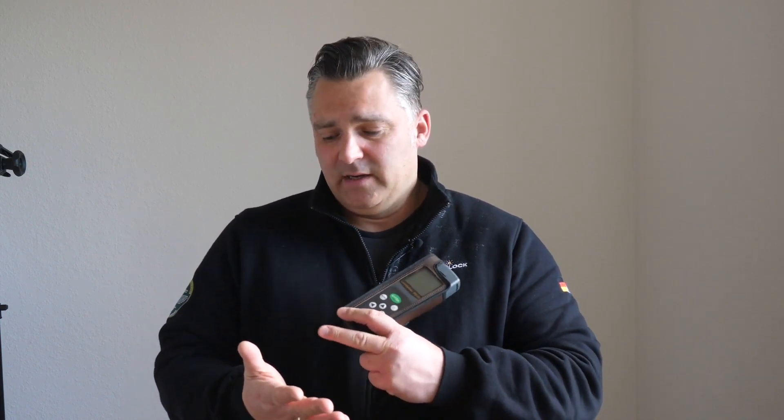So that you get a better feeling: on my skin you will see it's very high, or on the steering wheel it was very high. On a non-organic surface like a door metal push button or on the fridge plastic parts it starts less, and then it comes more or less after cleaning. When I test my finger it's 70,000-something plus, and after cleaning with a hygiene cleaner it goes down. When I clean my hands with water and soap it goes down even more.